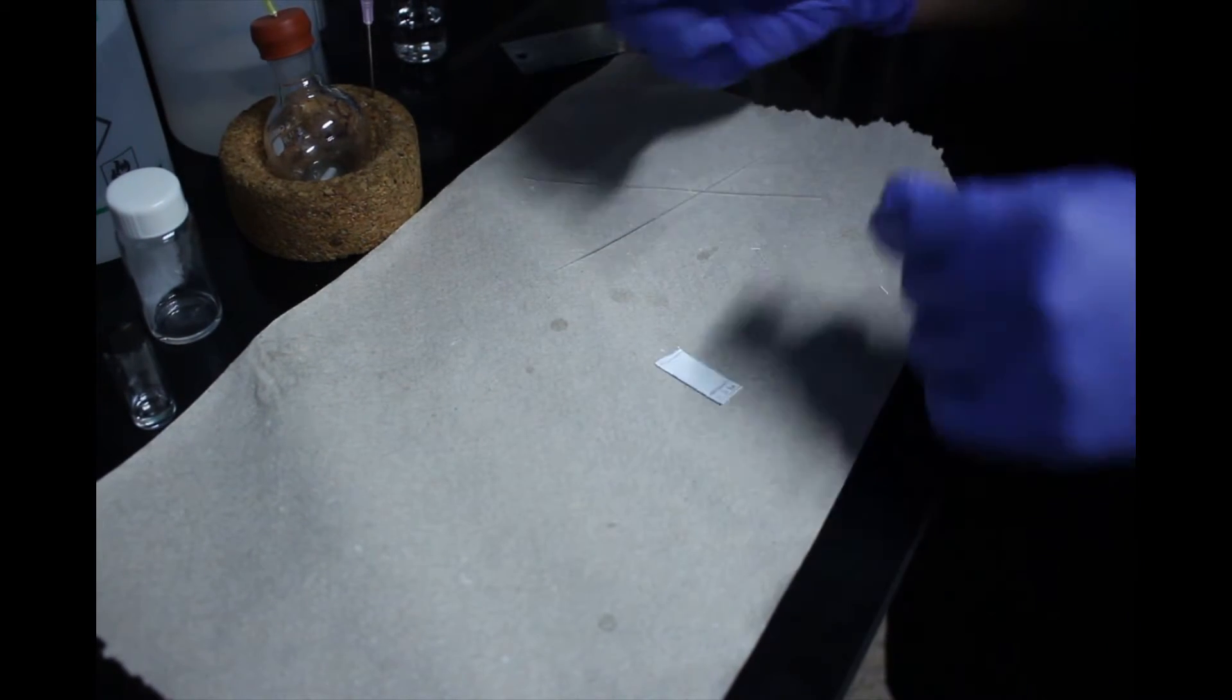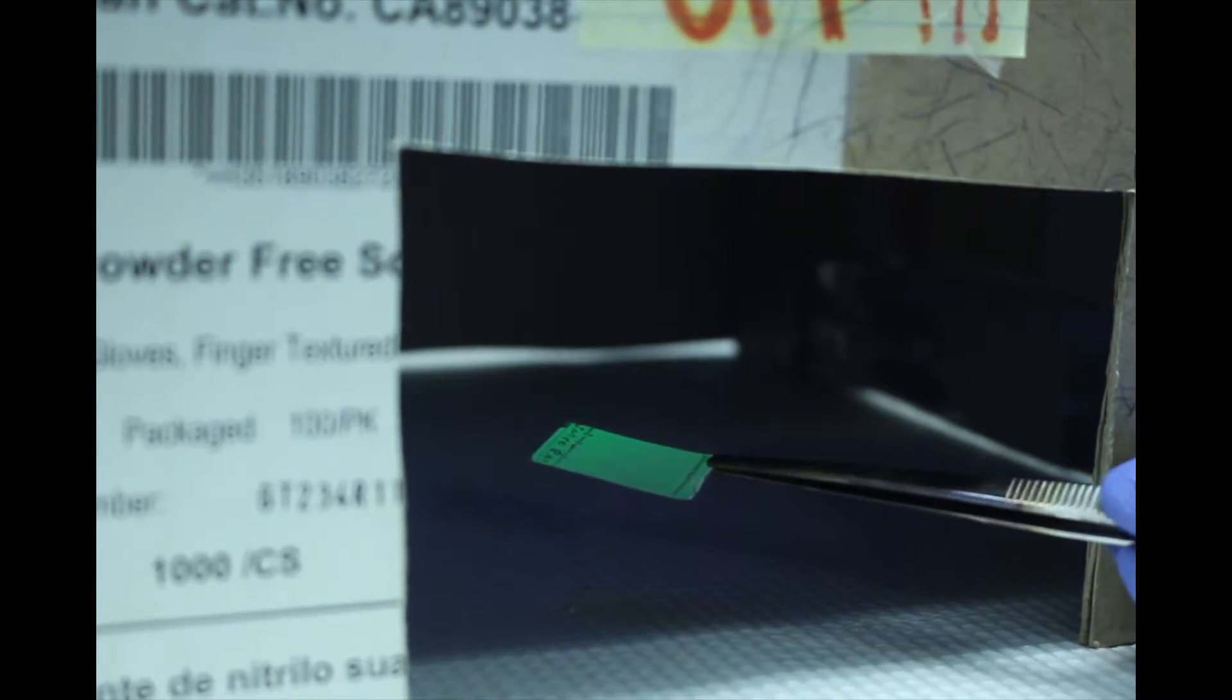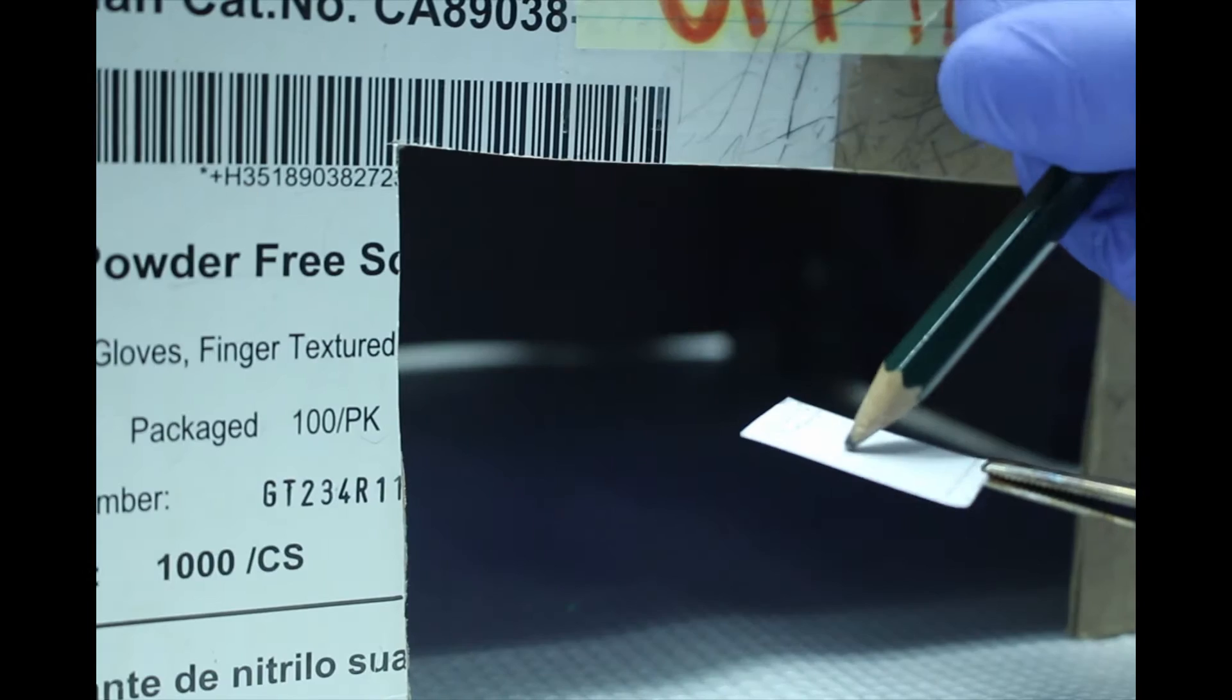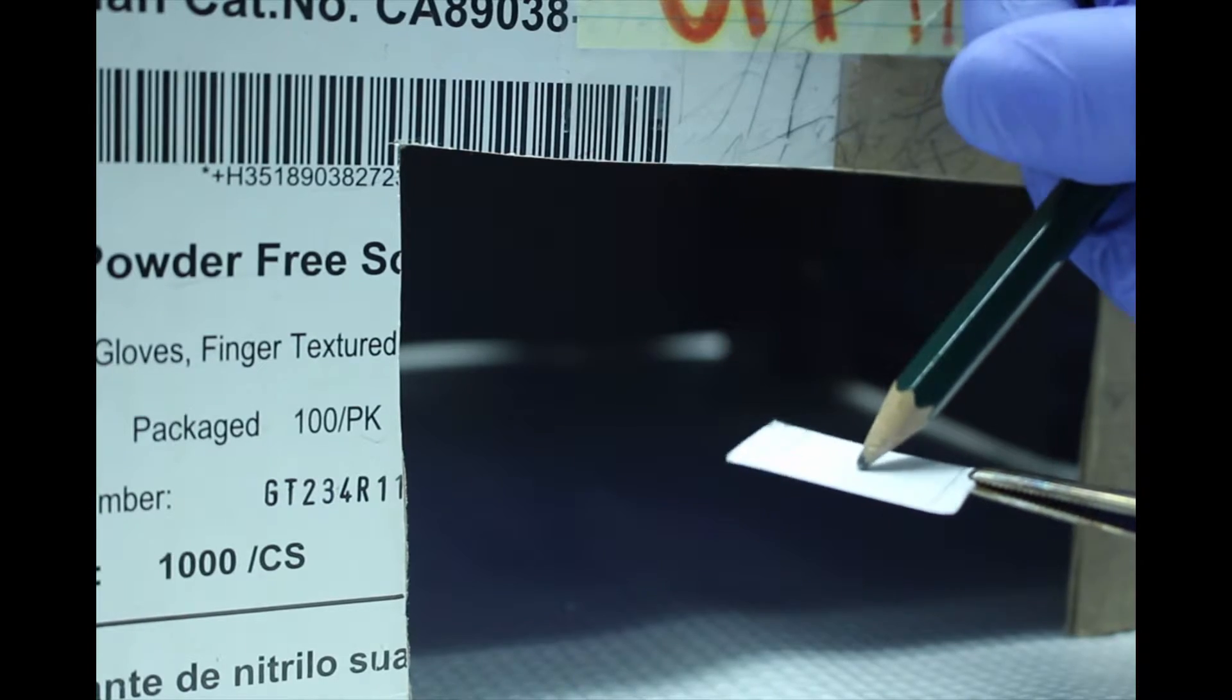Now it is time to visualize the TLC plate. Place your plate below a UV light to see which spots are UV active. Circle the spots with your pencil.